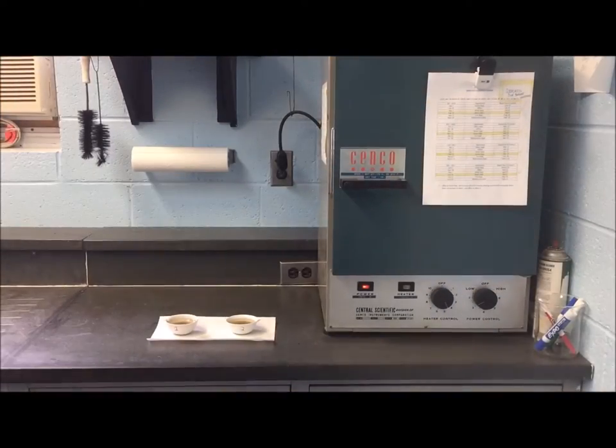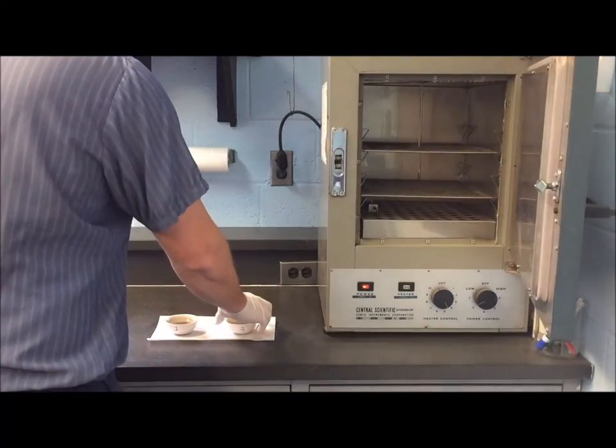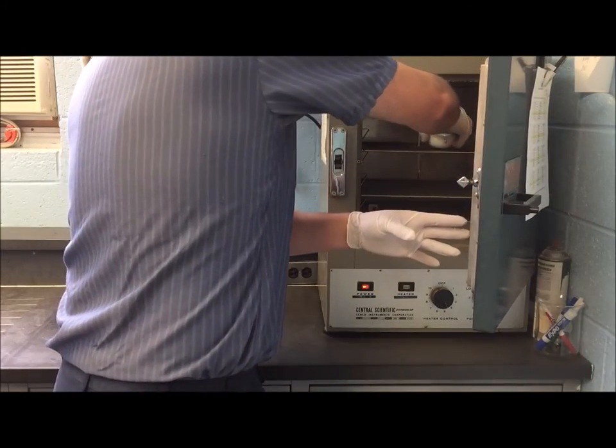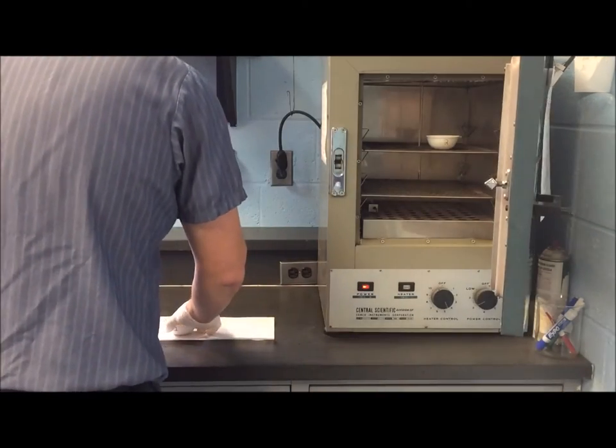To be able to measure the solids, the water must be removed from the samples. They are placed in an oven at a temperature of 103 degrees Celsius or 217 degrees Fahrenheit for at least 8 hours.